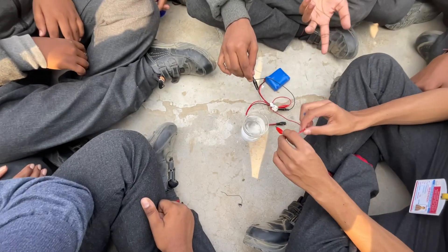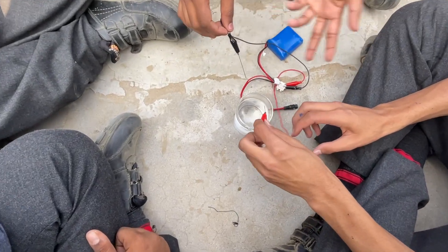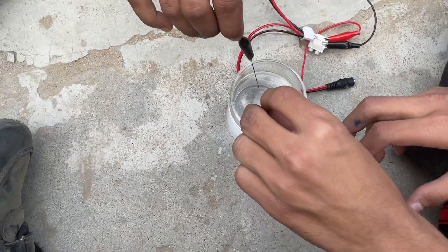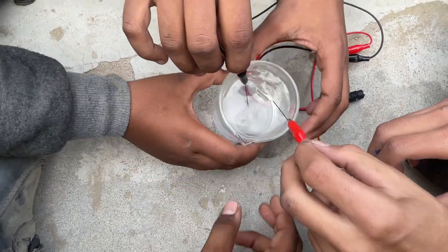Is there any timer? No sir. It's not a switch — it's not a circuit. Let's take the beaker so that the bubbles can be seen in the camera.